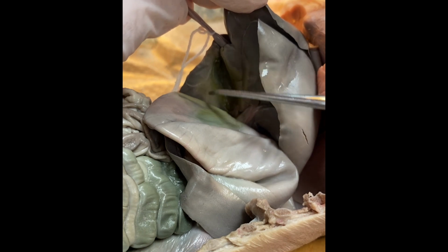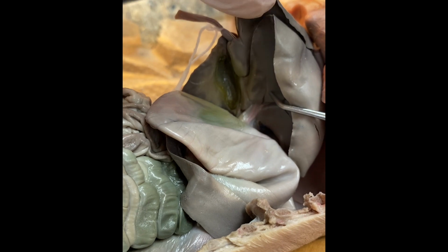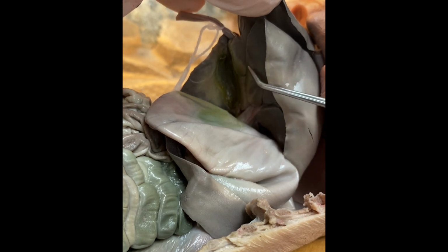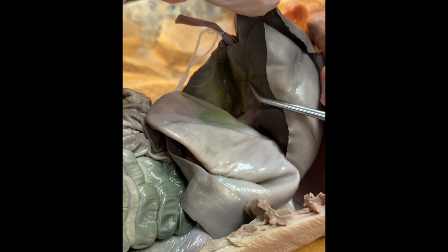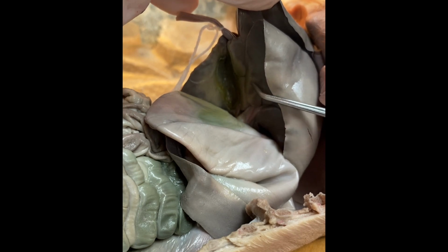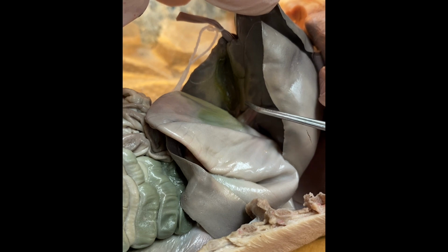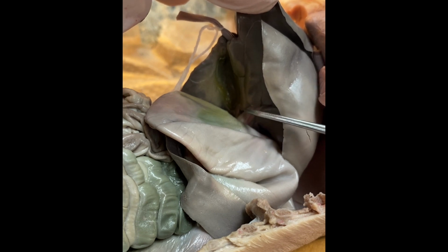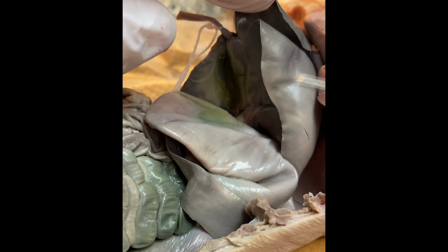The green structure that you can see here, that is actually the gallbladder. And the gallbladder is where we store bile that is produced in the liver, and bile is released slowly into the small intestine to help with lipid digestion. It does a process called lipid emulsification, which essentially turns the lipids into their constituent parts, such as the fatty acid tails, the glycerols, and that sort of a thing.